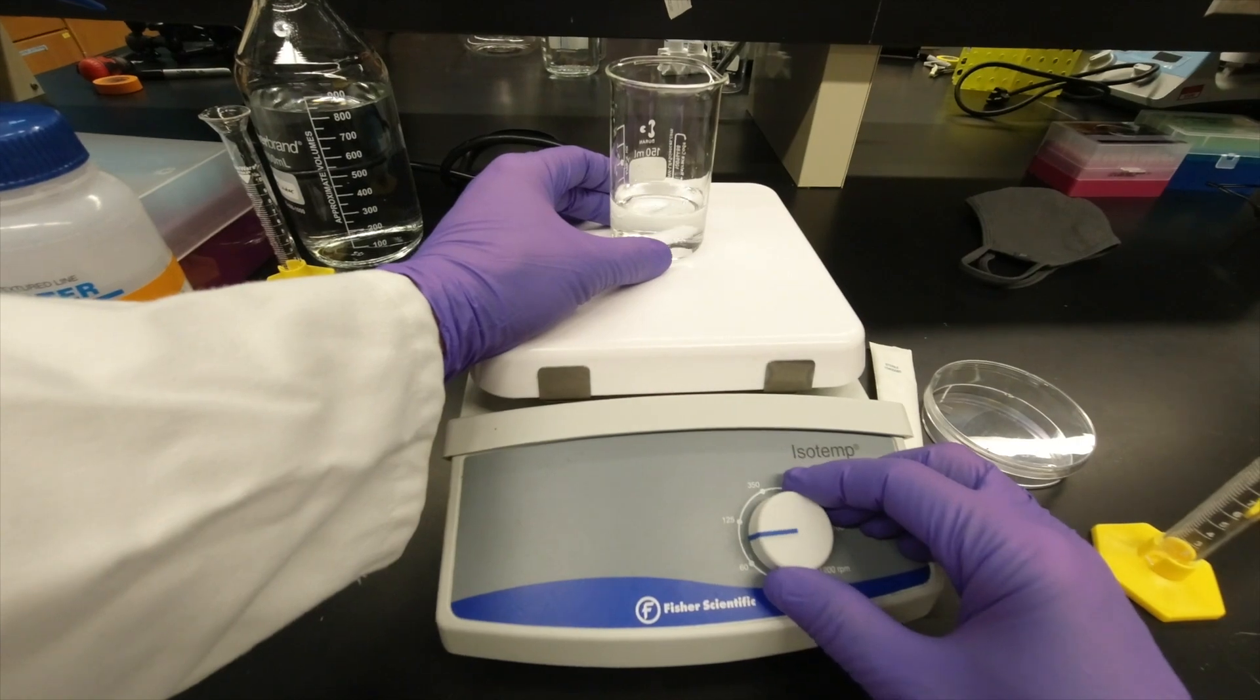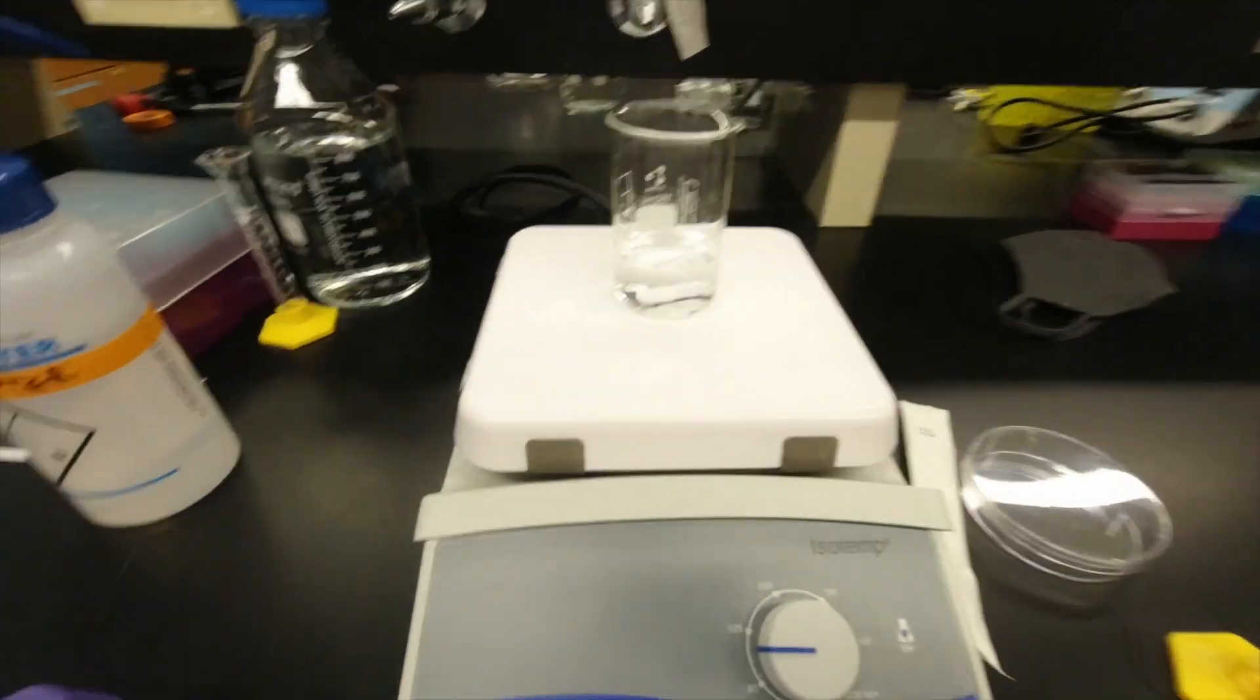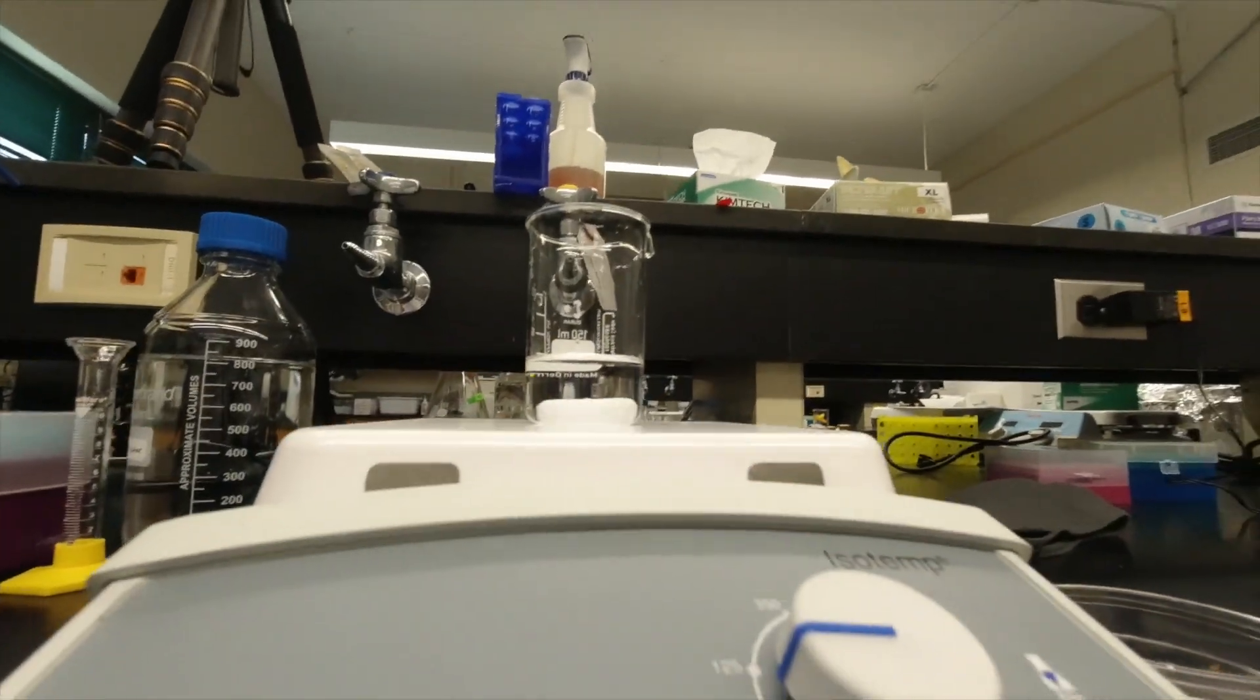And so then what you're going to do is get it stirring. You're going to look at the side.